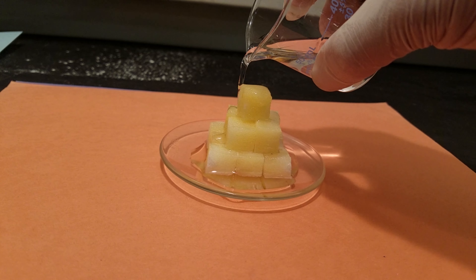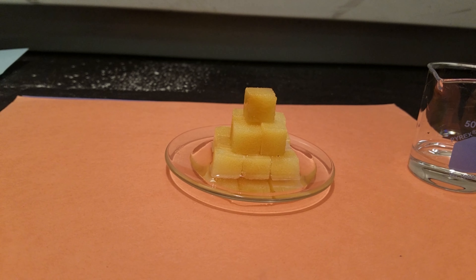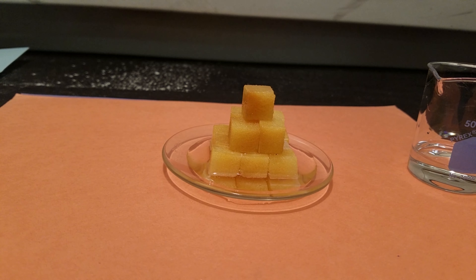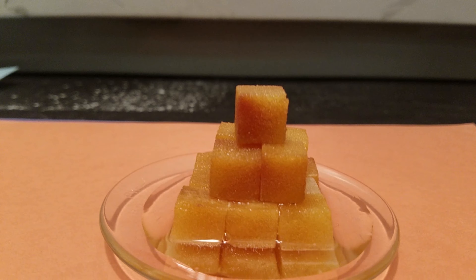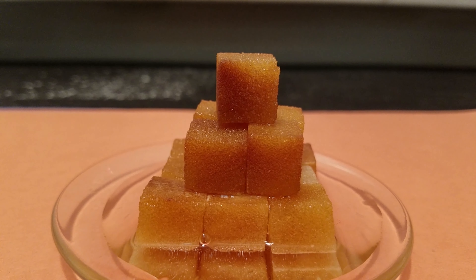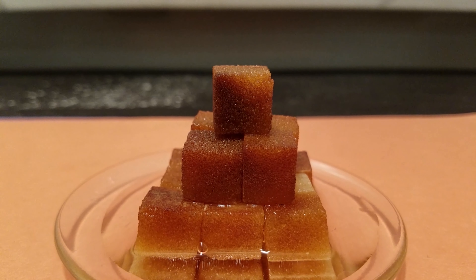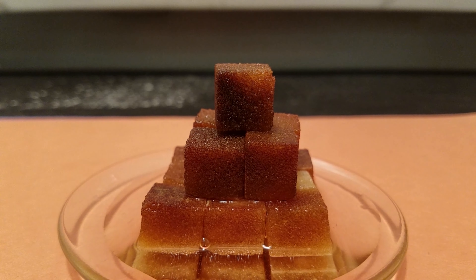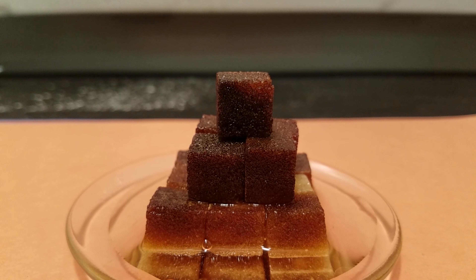As you can see, sulfuric acid is a very viscous substance, like oil. For precaution, you want to keep sulfuric acid away from little children, teenagers — you know how teenagers are — and also keep it away from communists.